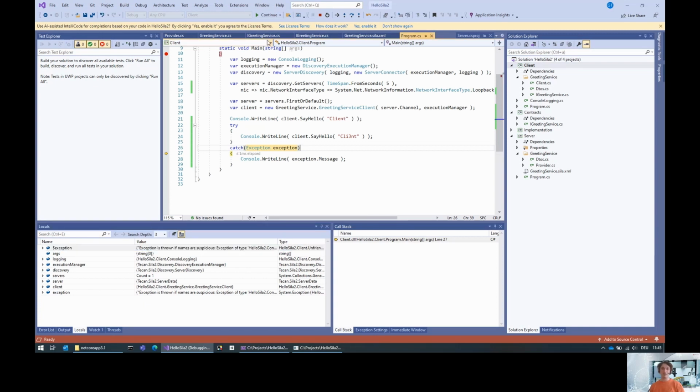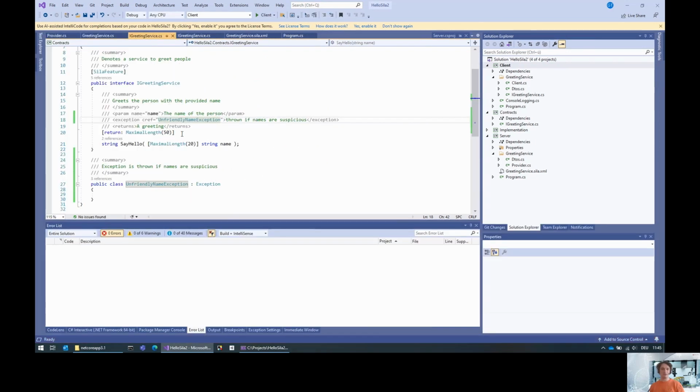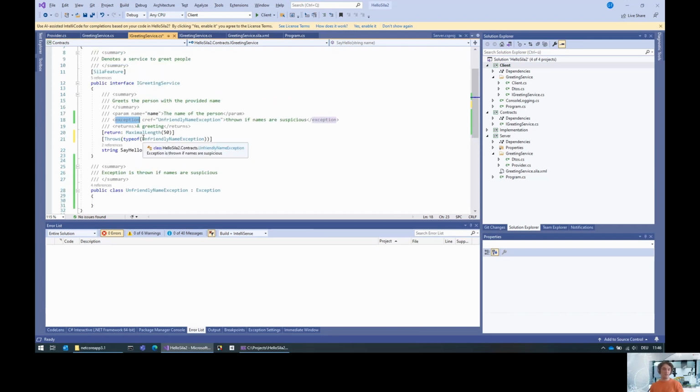So basically, all you have to do is specify this unfriendly name. Now, if for some reason you are not able to load the documentation, you can also do that via attributes. This has the same meaning, that you have this as unfriendly name exception. And this also works if you lose the documentation. It makes it a bit more robust, but if you can rely on your documentation file being generated, it is totally sufficient to just document that this method can raise an exception, which is a good idea in any case. So with that, that's basically it for exception handling.